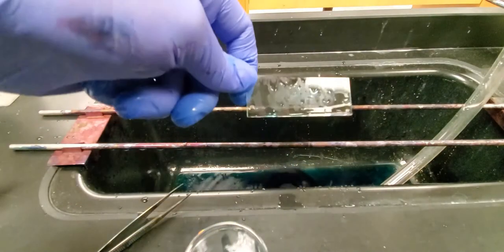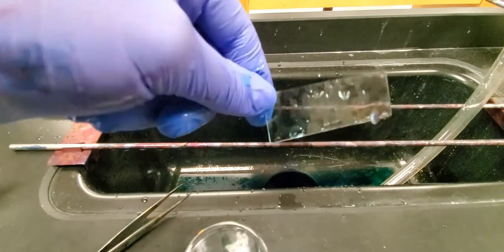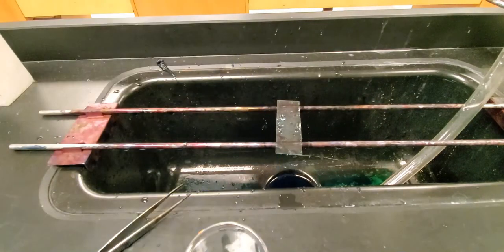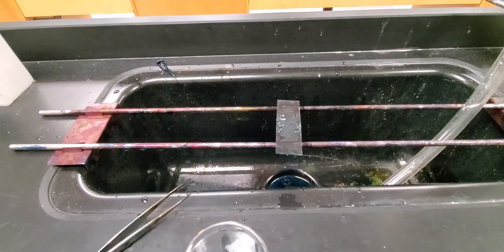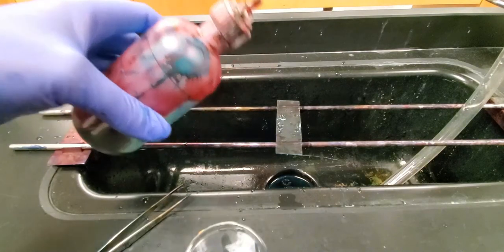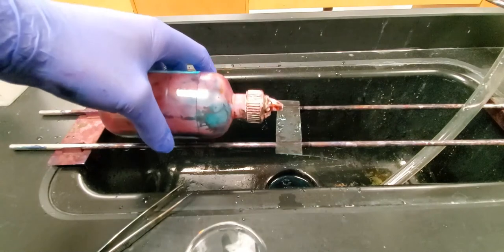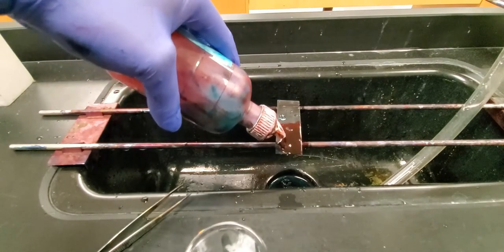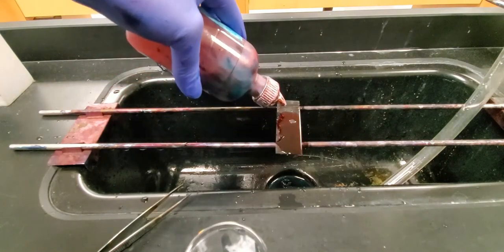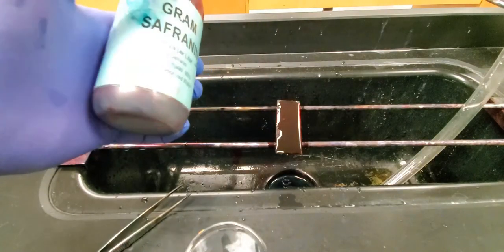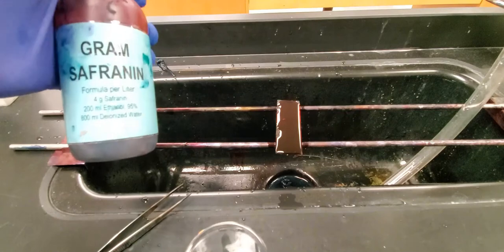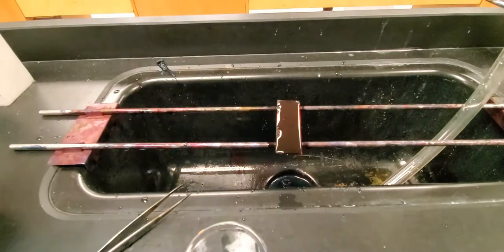If we take a look at our slide, we don't really see much of anything, again lack of contrast of the background. But we can come in now and do our counter staining. We've decolorized the cell bodies, and spores will be retaining the dye if it got into the spore coating. So we're just going to counter stain the cell bodies that were decolorized with the water using our gram safranin.